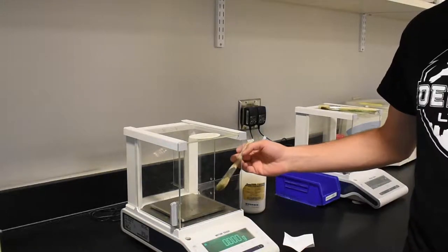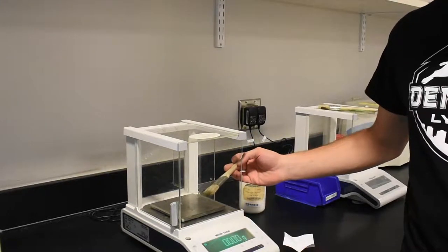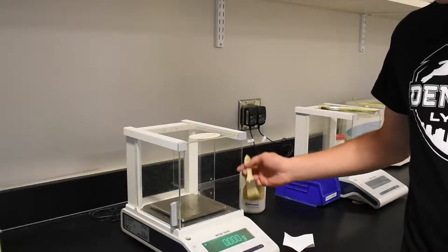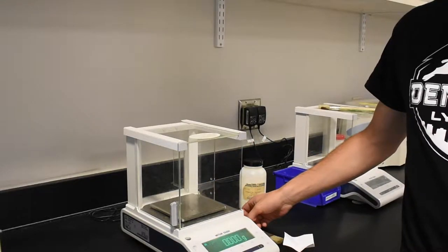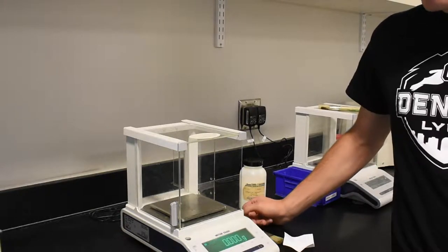Now a reminder, never get the balance wet. If there's something that isn't able to be removed with the brush, contact your TA. Never move the balance.